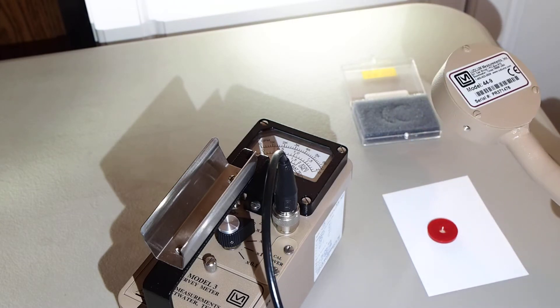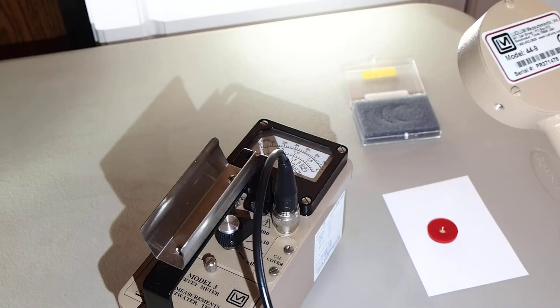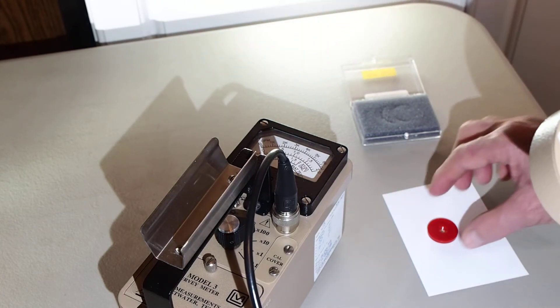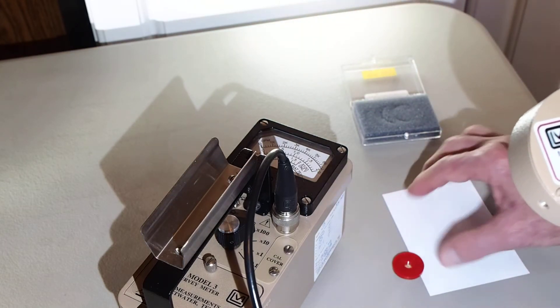Let's try something here. Look how quickly the meter falls away the further the pancake gets from the source. So let's place the source on the table here.